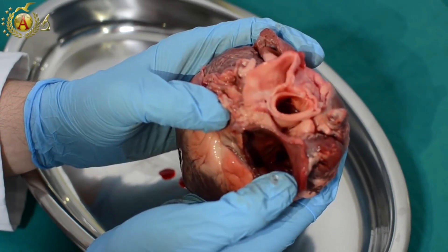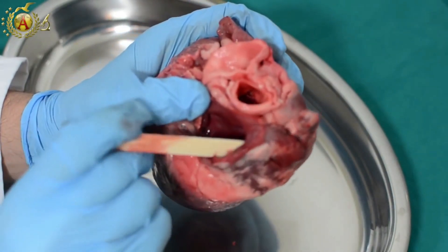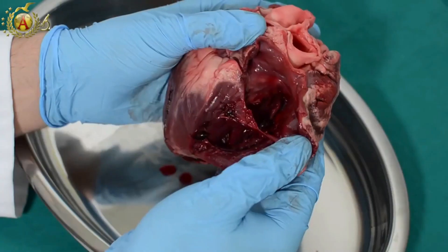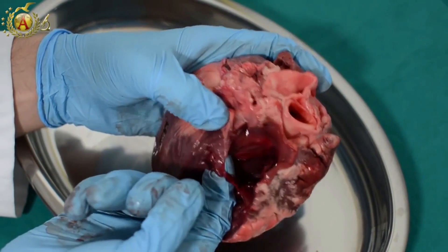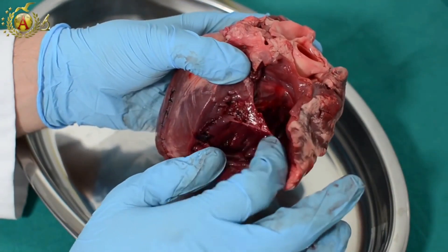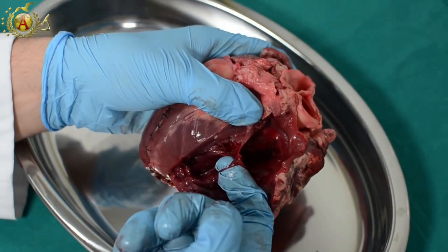Below, you can note, even if it is collapsed, the tricuspid valve orifice. The last thing to notice about the atrium is that by inserting a guide along the lateral wall, we find the auricle, which we know is hollow. We can continue cutting the edge of the heart to observe what is inside the ventricle. We see the passage between the atrium and the right ventricle. What we see here is the cusp of the tricuspid valve, and this is a piece of its fibrous ring — notice the resistance when pulled. The valve has the chordae tendineae, which are attached to the papillary muscles — these bumps on the wall. The chordae tendineae have an impressive resistance to being pulled, so much so that even trying to pull them with great force, they are not damaged.